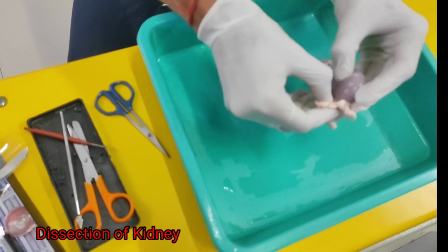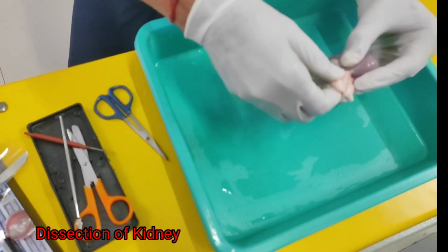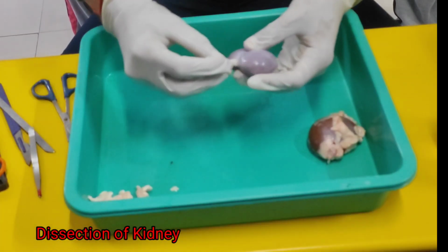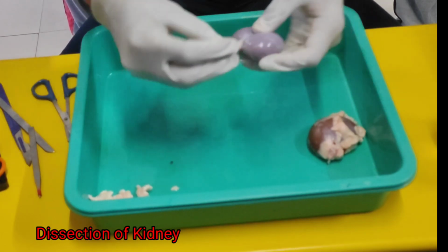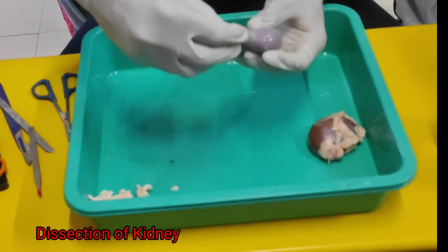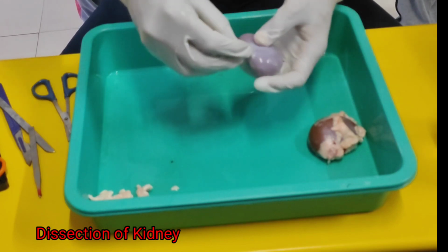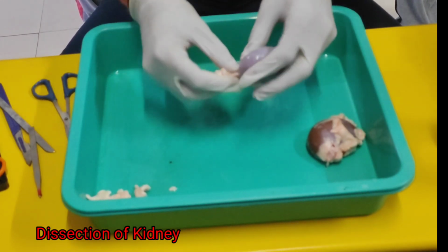During the kidney explanation, you have seen that there are three layers of the kidney, the outer covering basically. Okay, now we'll see the internal part of the kidney. This is the part where the renal arteries, renal veins and ureter come out. So we'll cut this and from here we can dissect it out.